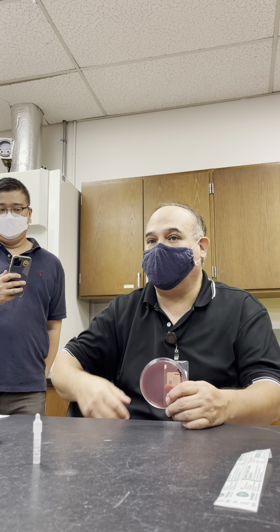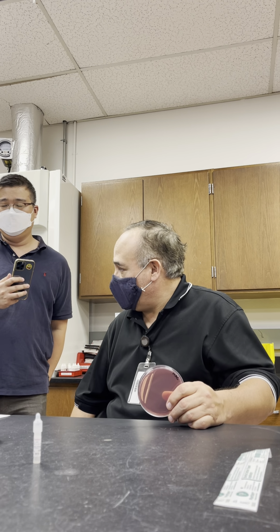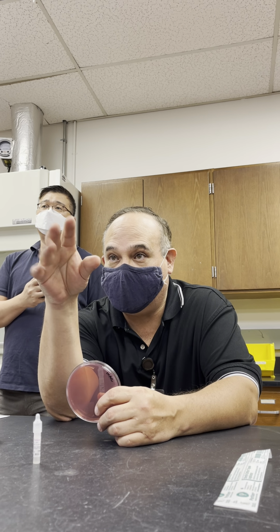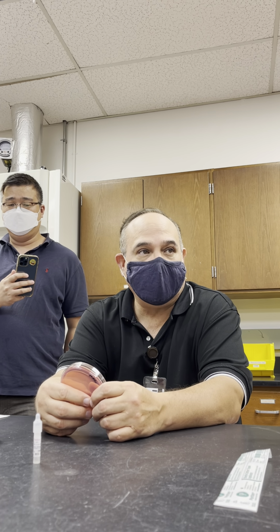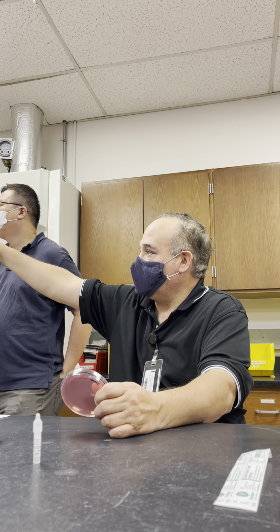The first time you heard about it, okay? Neutral red, when it is fermented, produces a brick red color. And the brick red color would be kind of like the color of the Bergey's manual right over there, that hot pinkish color. You with me? So if you have that, then it's a lactose fermenter. If it's a colorless colony on here, then it's a non-lactose fermenter. Okay? Good? So you can see I put the ingredients over here: lactose, neutral red, crystal violet, and bile salts are there also, but they're there to inhibit the growth of gram-positive organisms. Okay? So only gram negs will grow here.